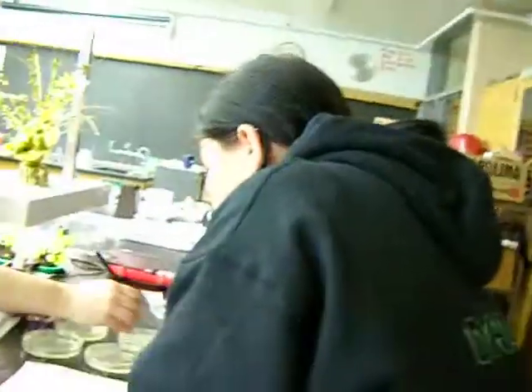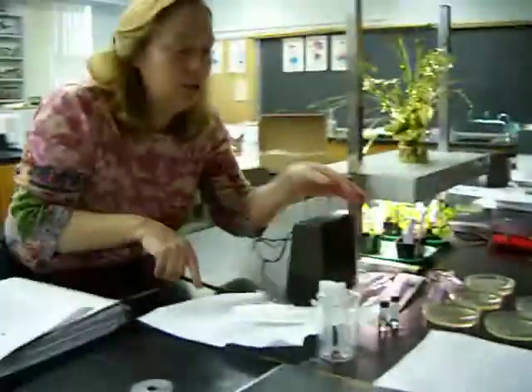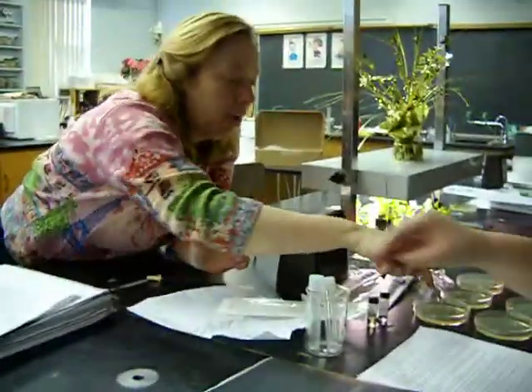Okay, there's 14. Oh, sorry. Three would go over to 15. So you're going to take the plus one. Hey, yeah, look, put 100 in here, 100 there, 100 in here.